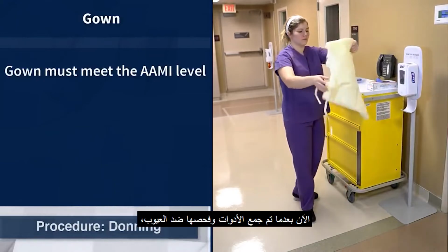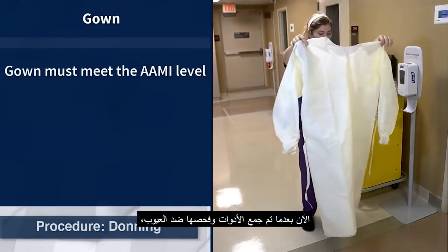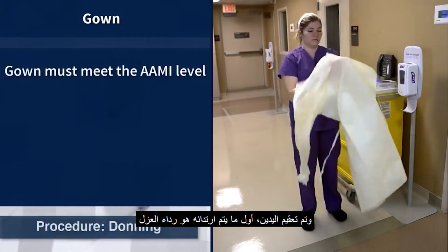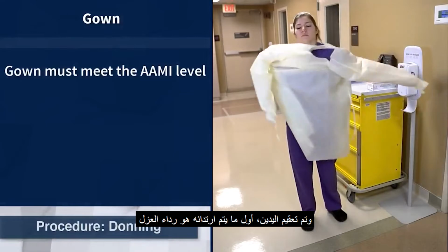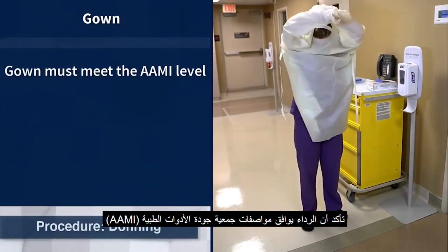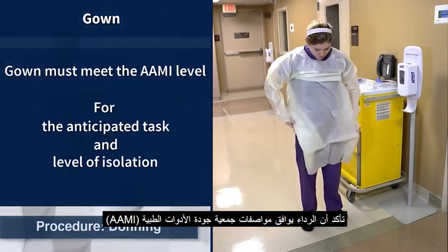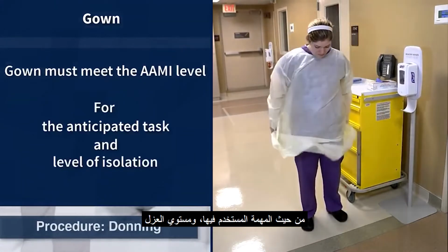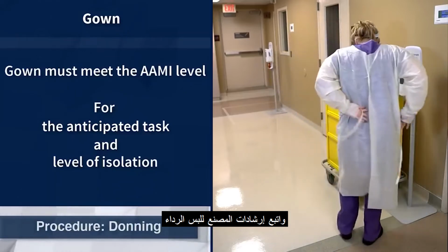Now that the appropriate PPE has been gathered, checked for defects, and hand hygiene performed, the first item to be donned is the disposable isolation gown. Ensure the disposable gown meets the Association for the Advancement of Medical Instrumentation's standard for the anticipated task and level of isolation, and don the gown following the manufacturer's recommendations.